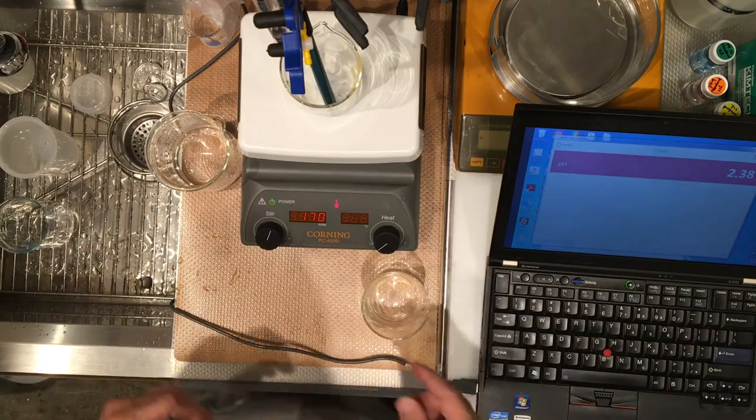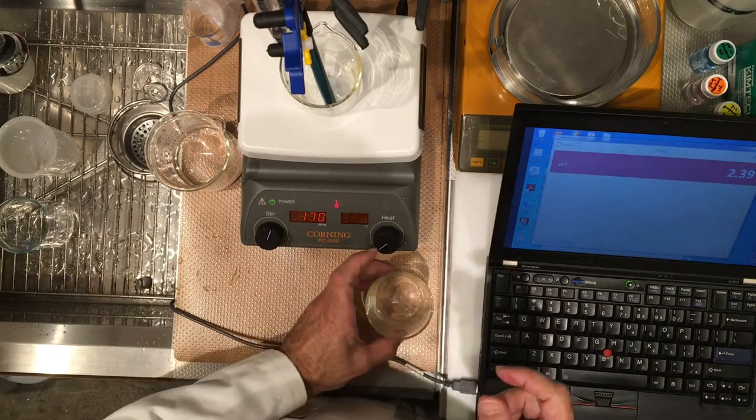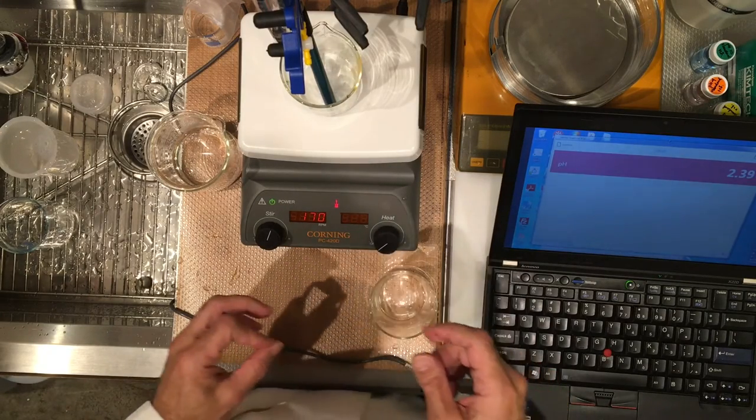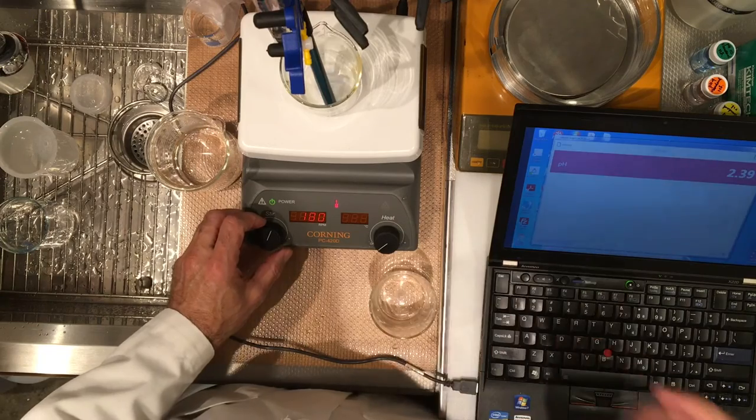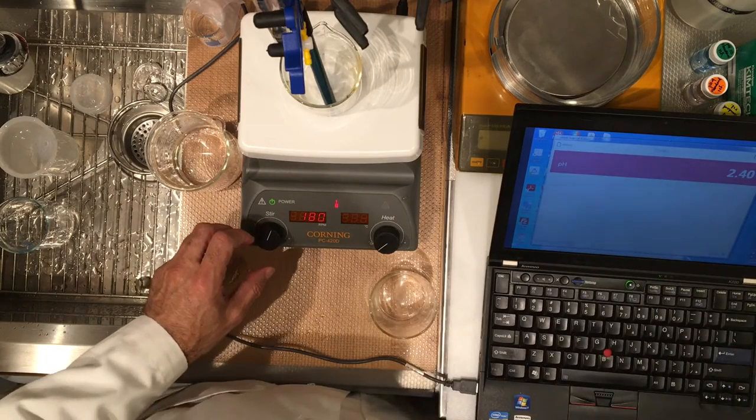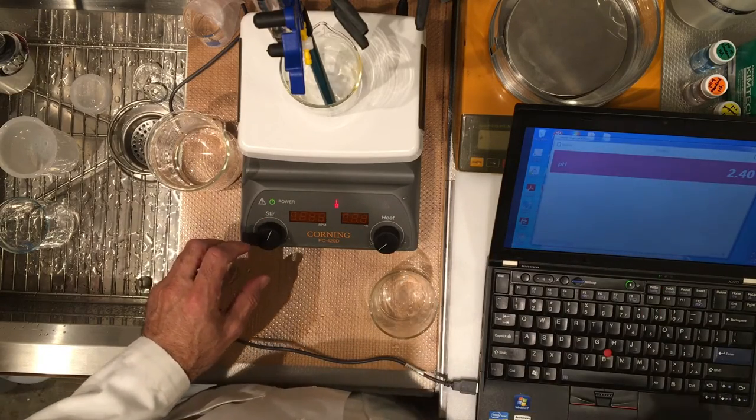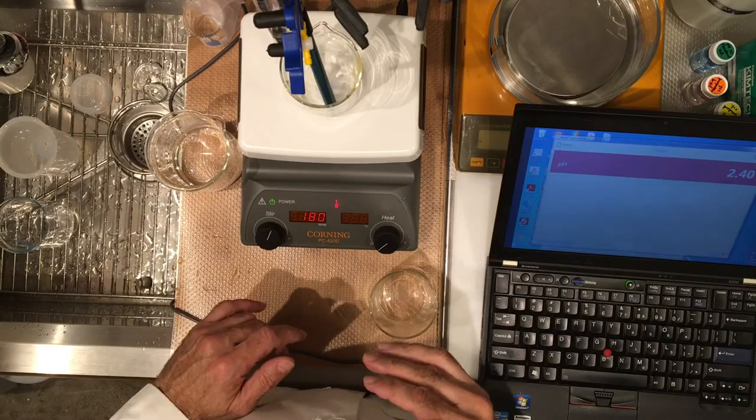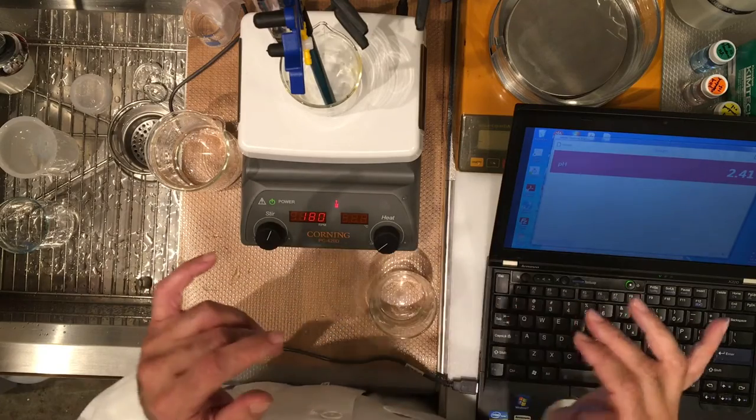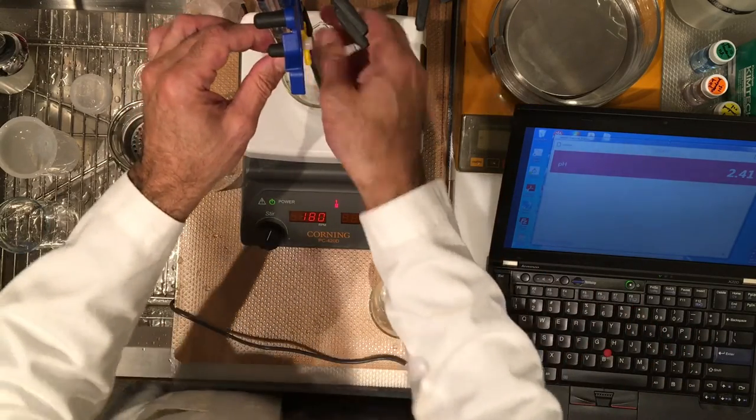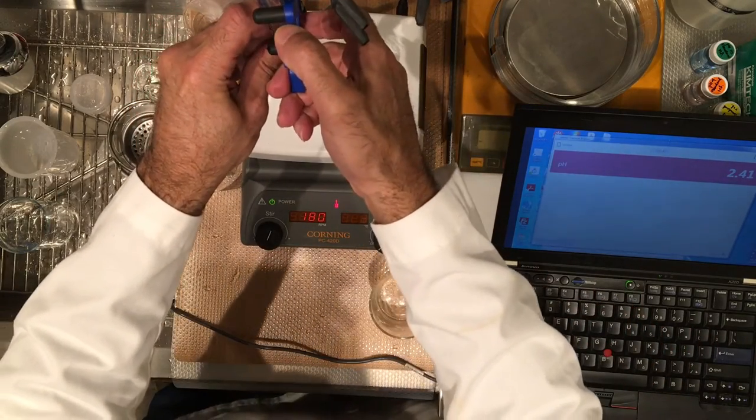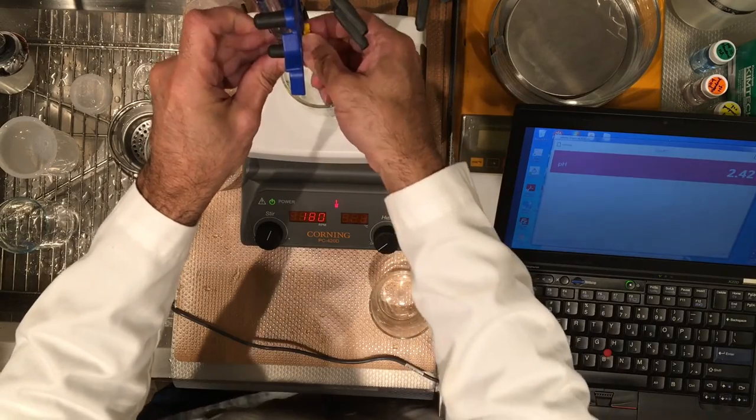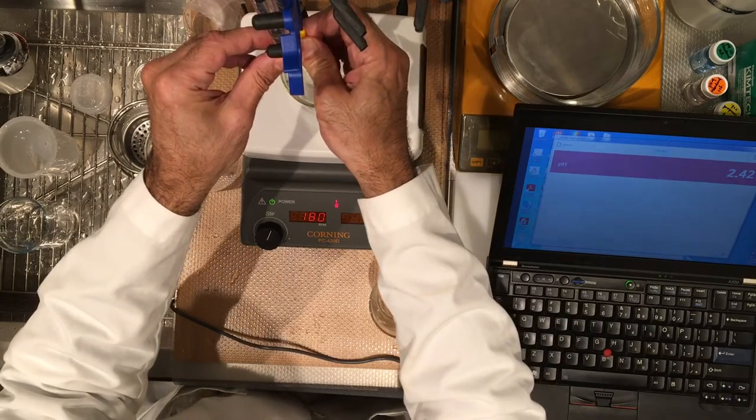A little bit more sodium hydroxide. Okay this is ready to go. So we have our second titration going now. So you had the pH not this one the pH you recorded at the very beginning and now that's a zero so let's go ahead and add. So my first increment is 0.50 milliliter.